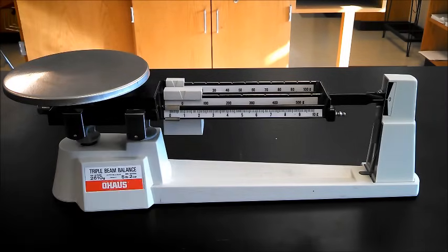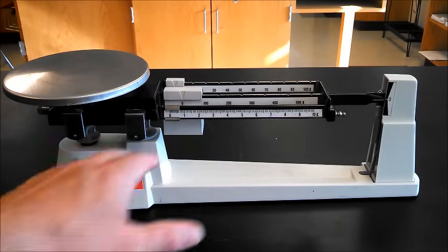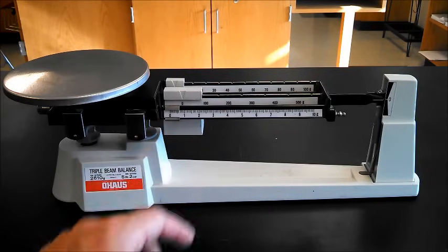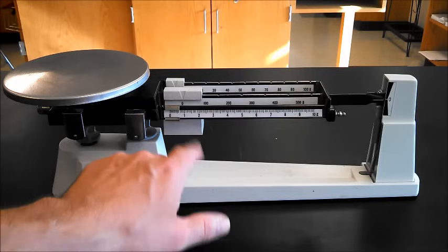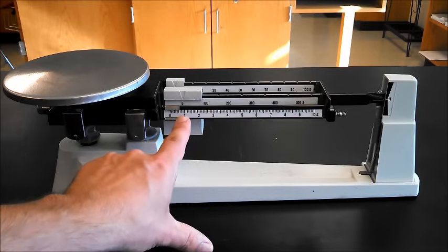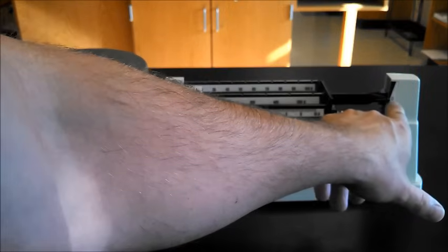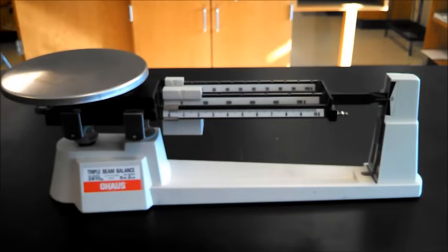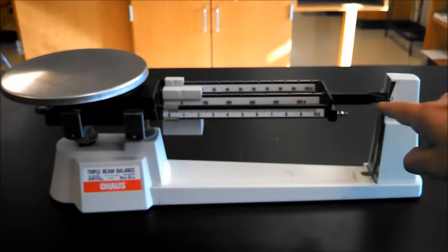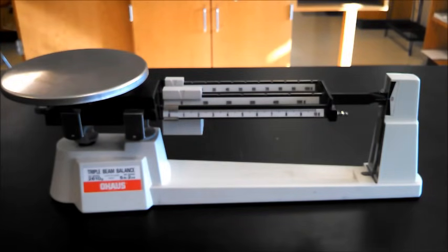These are the arms. We want to make sure that when we start, the weights on these arms are all the way down here. It's what we call having it zeroed. And we also want to make sure that we have this lined up right here with each of these little lines on each side matching.